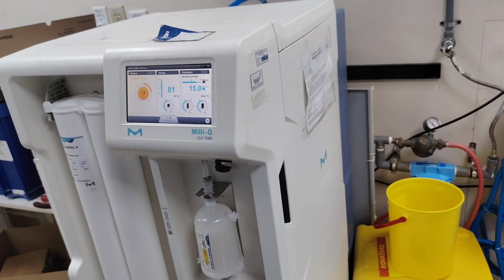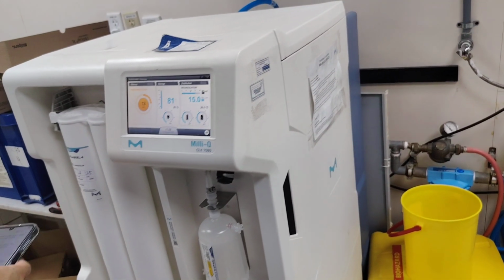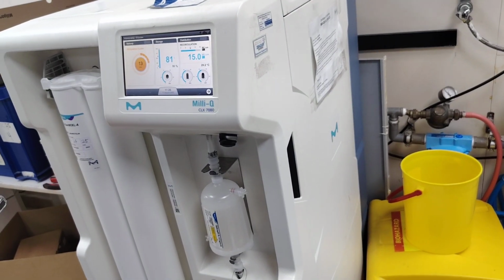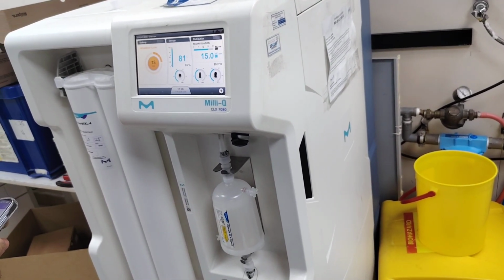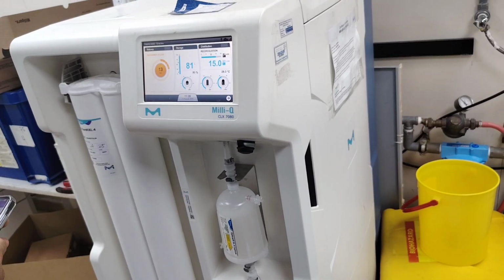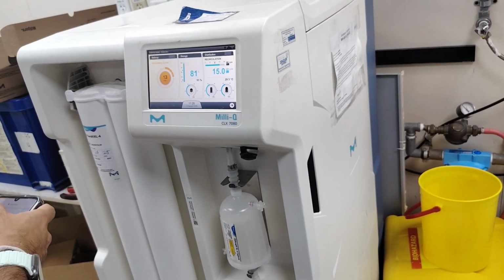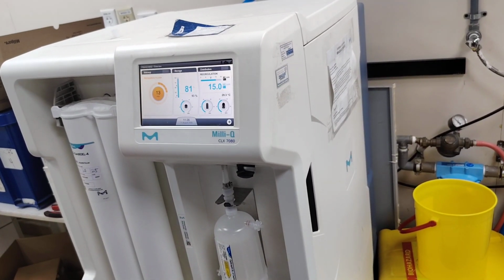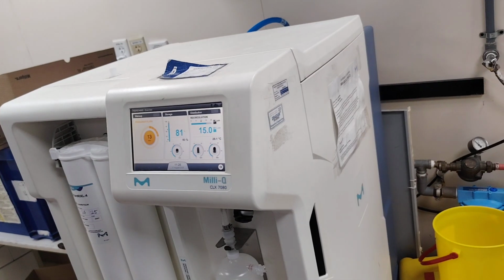Still not programmed, so I'll just do the report. Guard flashing.